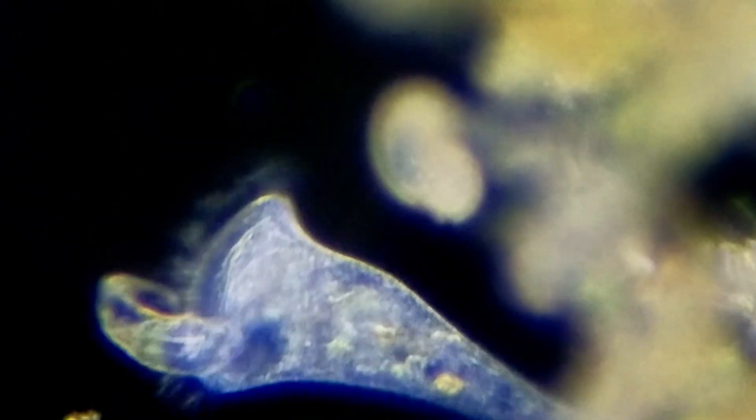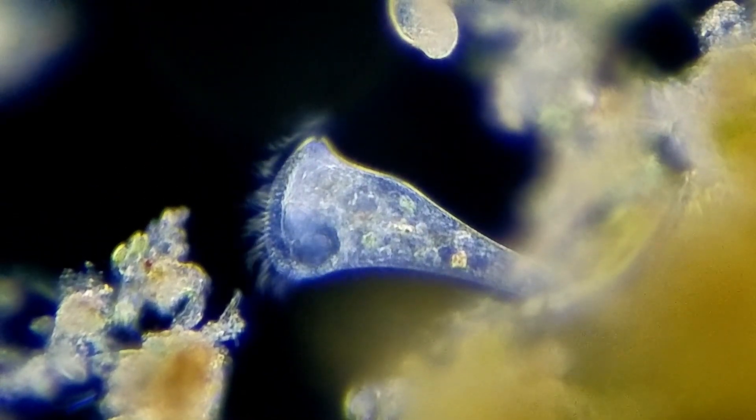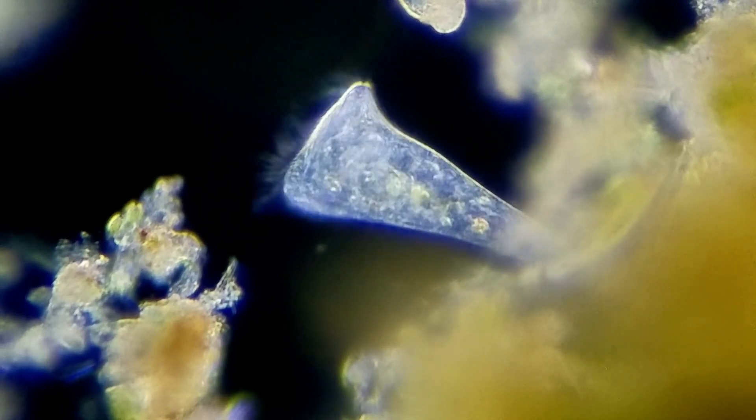Now look at that — that's a rotifer. A rotifer swam too close to the stentor and got stuck there for a second. The rotifer is too big to be swallowed by the stentor — there goes the rotifer again. That was just a total accident for the stentor; he contracted when that happened and kind of spit out the rotifer. Now if you look carefully at the bottom, at the front of the mouth of the stentor, there's a small organism that he has trapped. It can't get out because the stentor is creating that vortex sucking it in, and it just kind of hangs there.